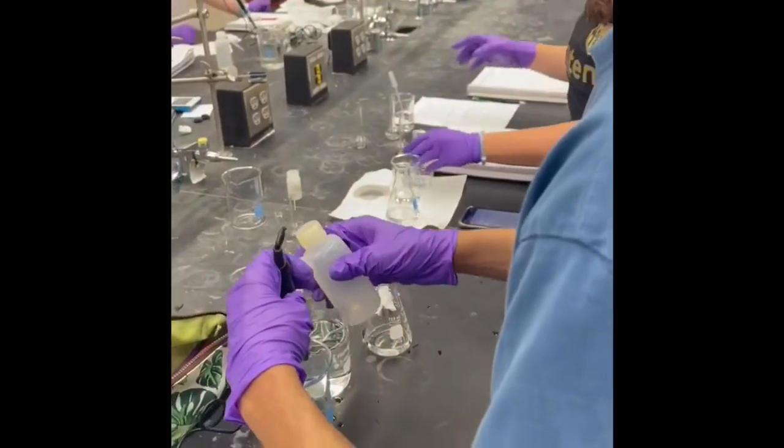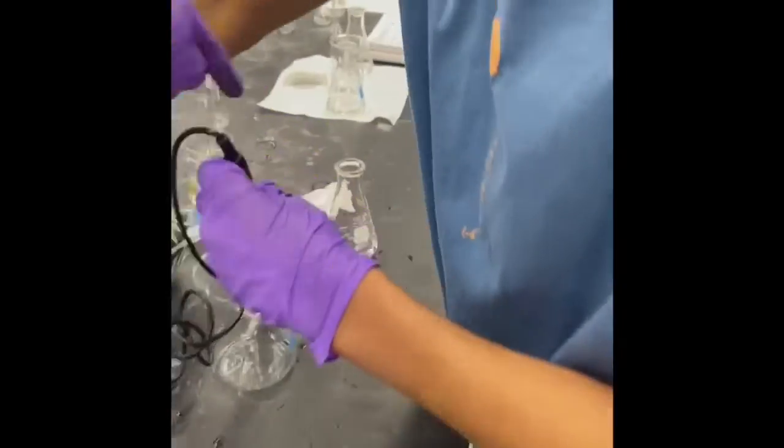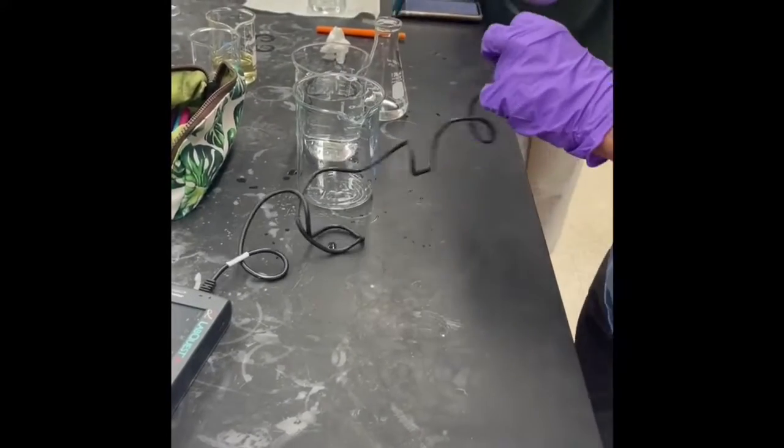We were then able to test the pH of an unknown solution. Since we calibrated the meter properly, it would show us a pH of around 3 when input into the unknown. This told us that the unknown solution we had was acidic.